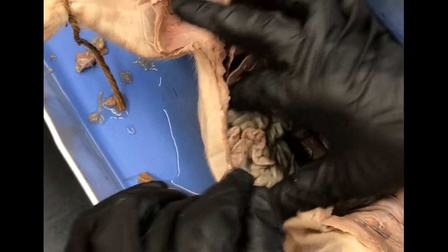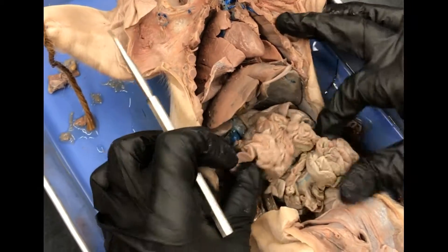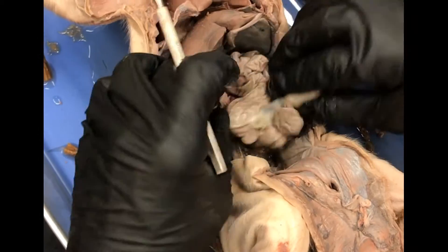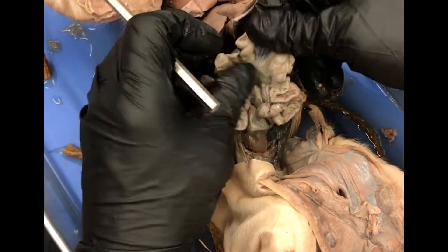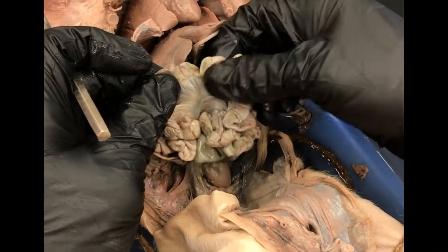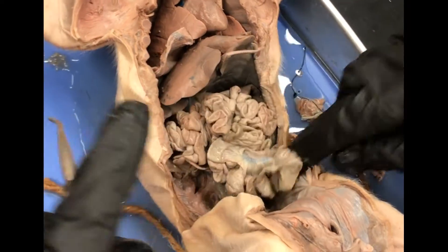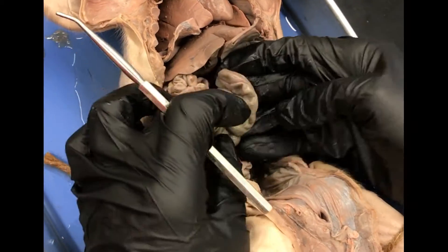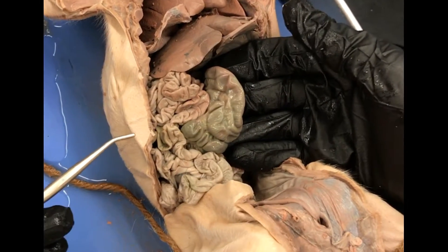If you pull all this stuff aside, all of this is your small intestine. You can see if you spread it out, you can see the membrane that's holding it together — that's the mesentery. So that membrane holding the small intestine together is the mesentery, and then this big thick one that looks a little more organized, the big thick green one, that's the large intestine.